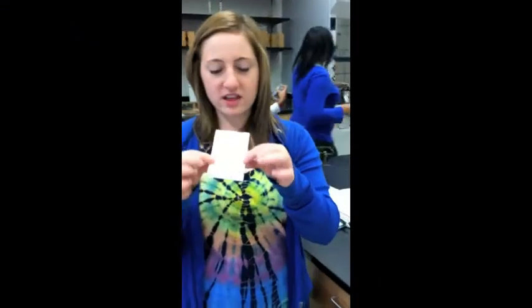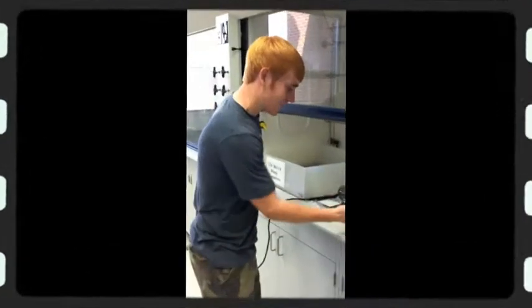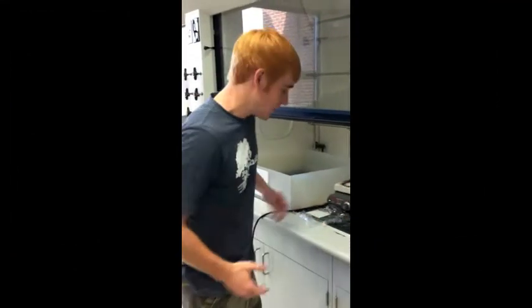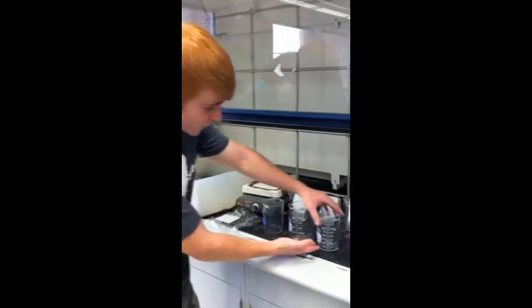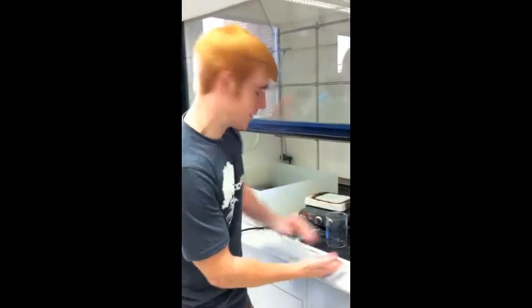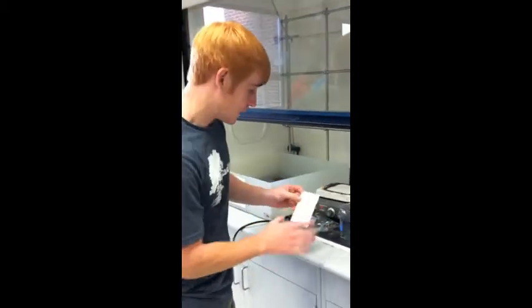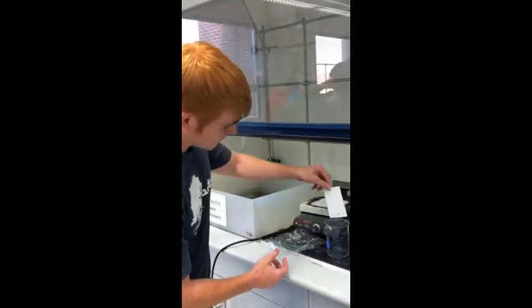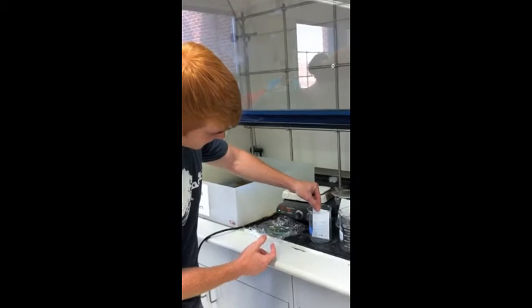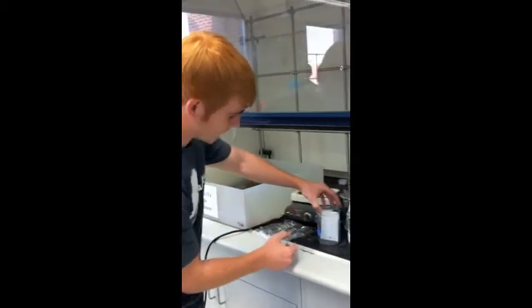Okay, after we dotted all of our lines, this is what all of our dots look like. Now we're going to go place this in our beaker. We have our 3 solvents, or mobile phases. This one is 15 to 2, this one is 1 to 1, and this one is 1 to 1. Here we have our TLC plate. And now, I'm going to place this in the 15 to 2 beaker. Like that. Then I have to cover this with a watch glass.